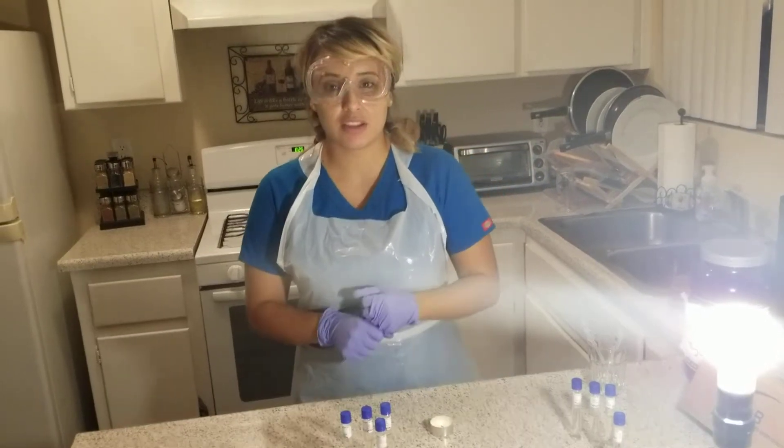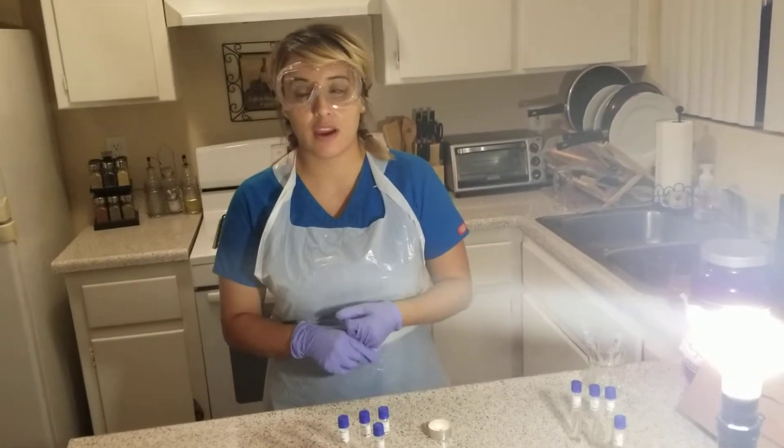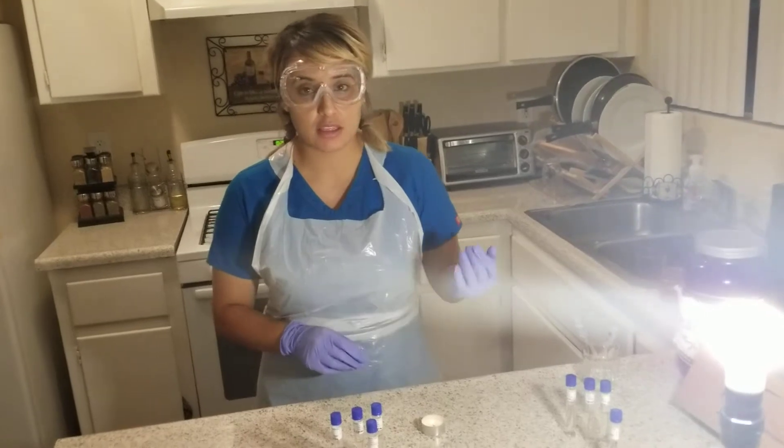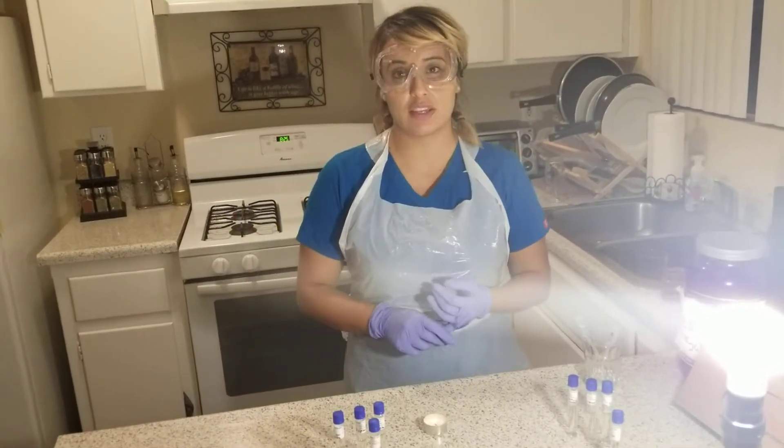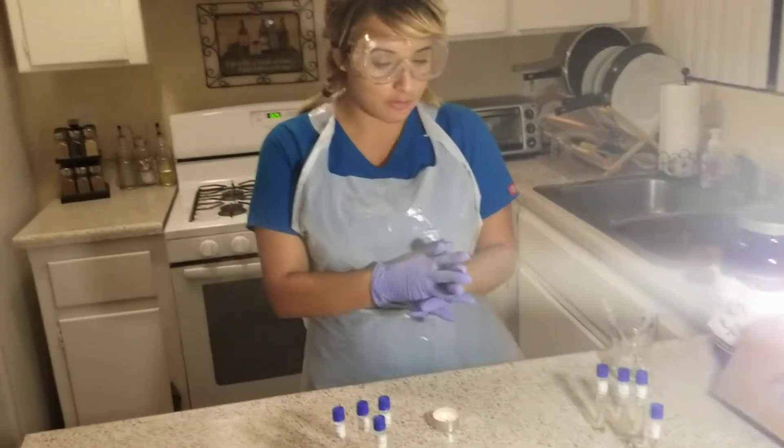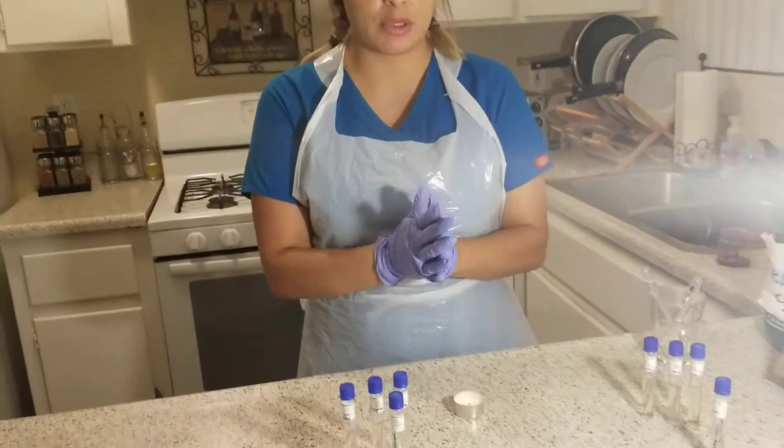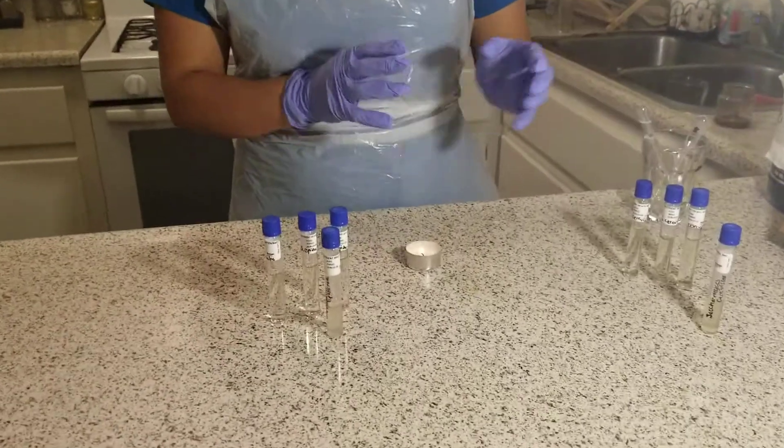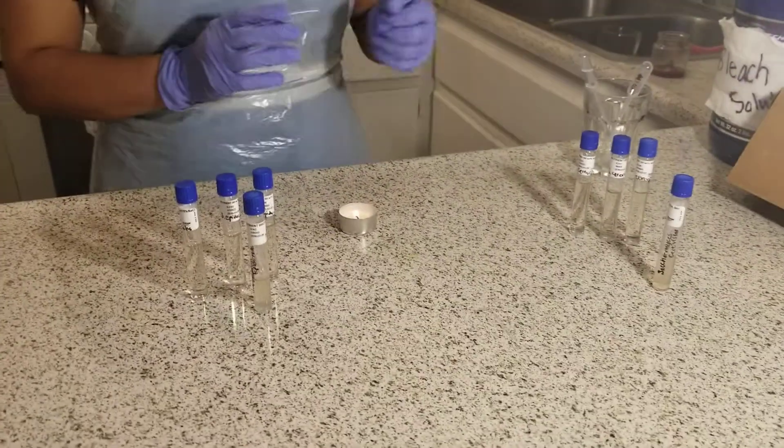Hi, my name is Alicia Cota. This is Bio 225 Week 6. Today's date is June 12th, 2018. In today's lab experiment, called Environmental Influences of Microbial Growth, this exercise is number one, the salt tolerance test.